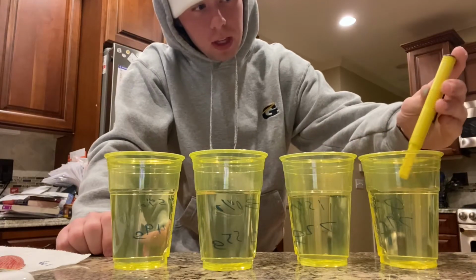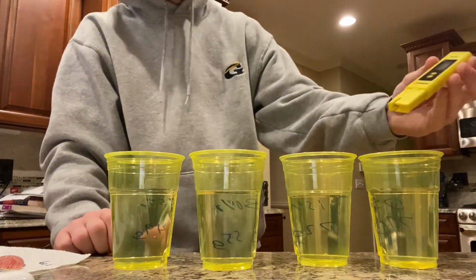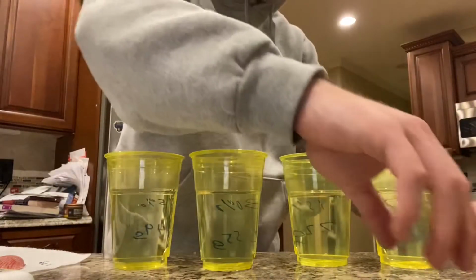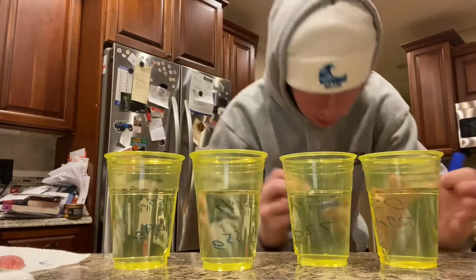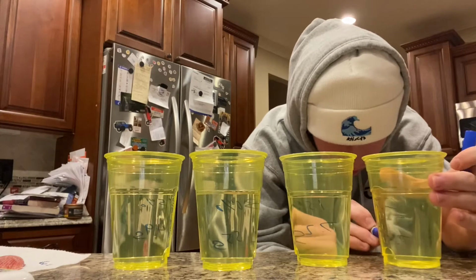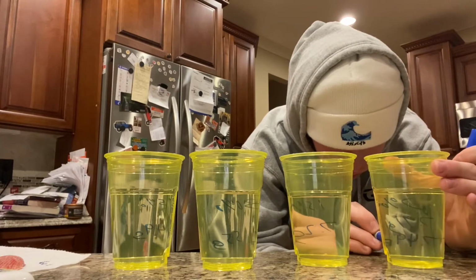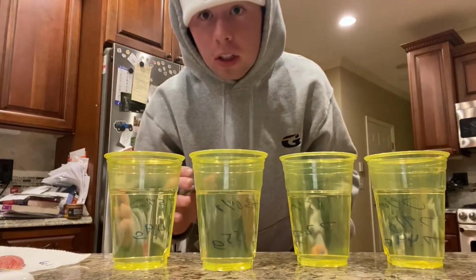All right, so we have a pH of 7.49 for that solution. So we're just going to mark that down on our cup. And then we'll just do that for the rest of the cups as well.